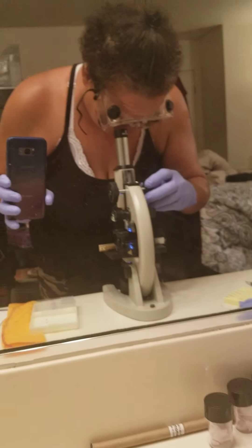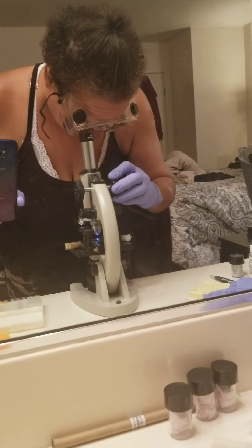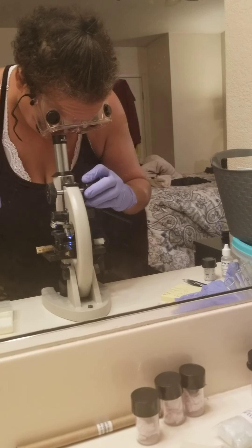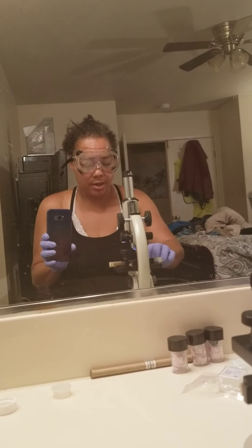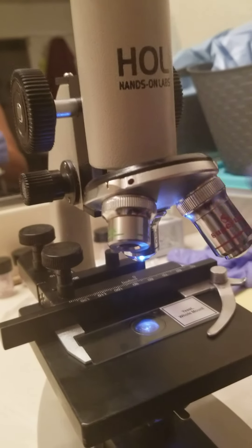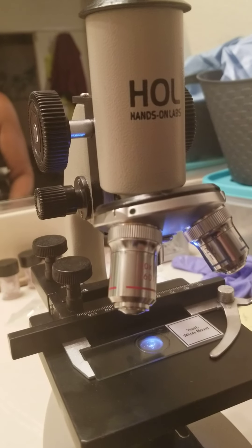As I am looking, the first time I was able to see the yeast, but when I did get the oil immersion, somehow I lost all the yeast on the slide. So this is the only one. Yeast has not been my friend — I've had trouble with these, this is the second week in a row. Placing out my plate, placing my specimen on the plate, putting it in place and holding it, allowing it to move back and forth, clicking to make sure my lens is actually in place.